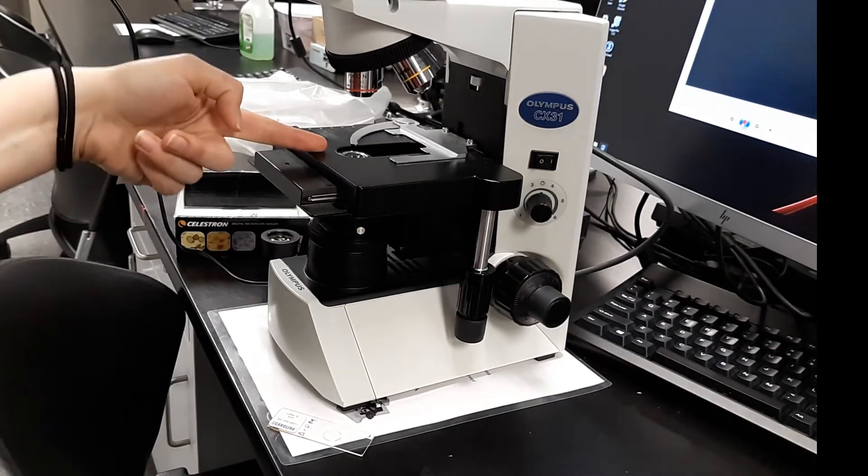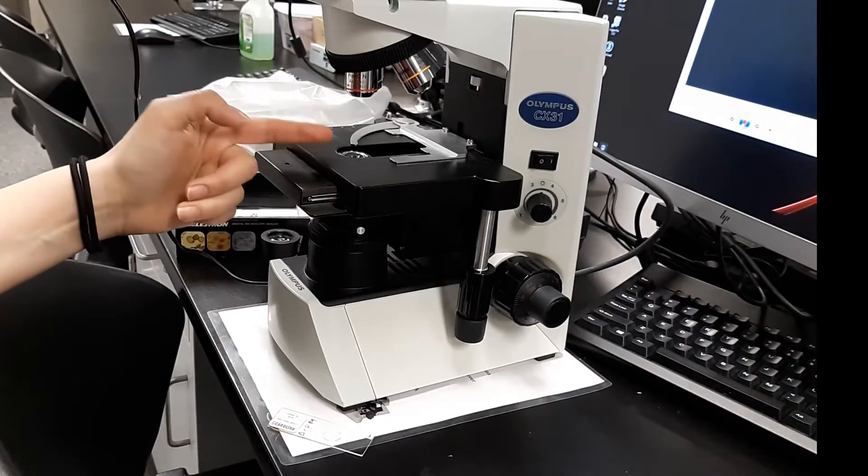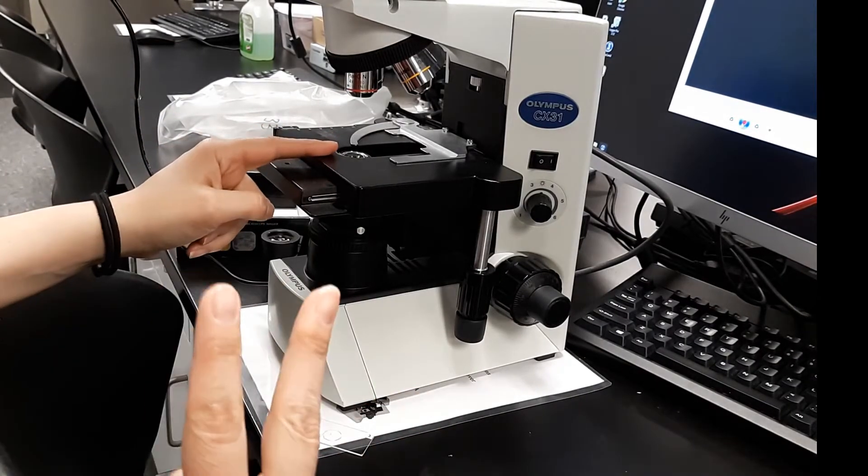If you notice, we're trying to look for light through here. I see a slight gold hue, but not much. What we're going to do is we have two more things to adjust.